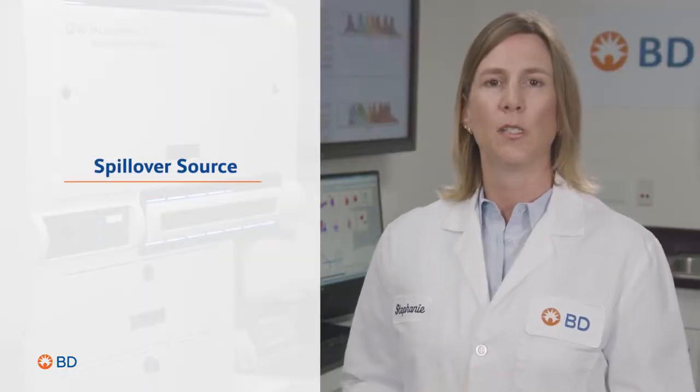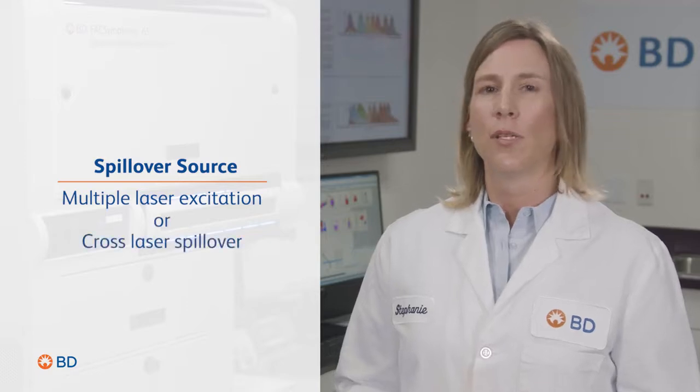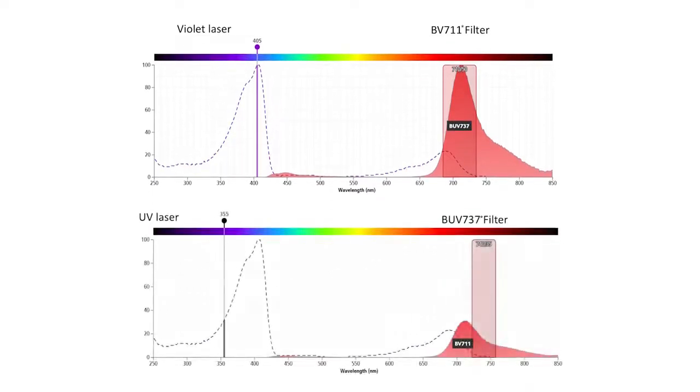Finally, the third source of spillover occurs due to multiple laser excitation. This is also known as cross-laser spillover. While every fluorochrome excites best off a specific laser, there can also be excitation from a secondary laser. Here you can see that BV711 not only emits into its own detector when excited by the violet laser, but is also excited by the UV laser, emitting into the BUV737 detector. This is because both the BV711 and BUV737 detectors collect similar wavelengths.